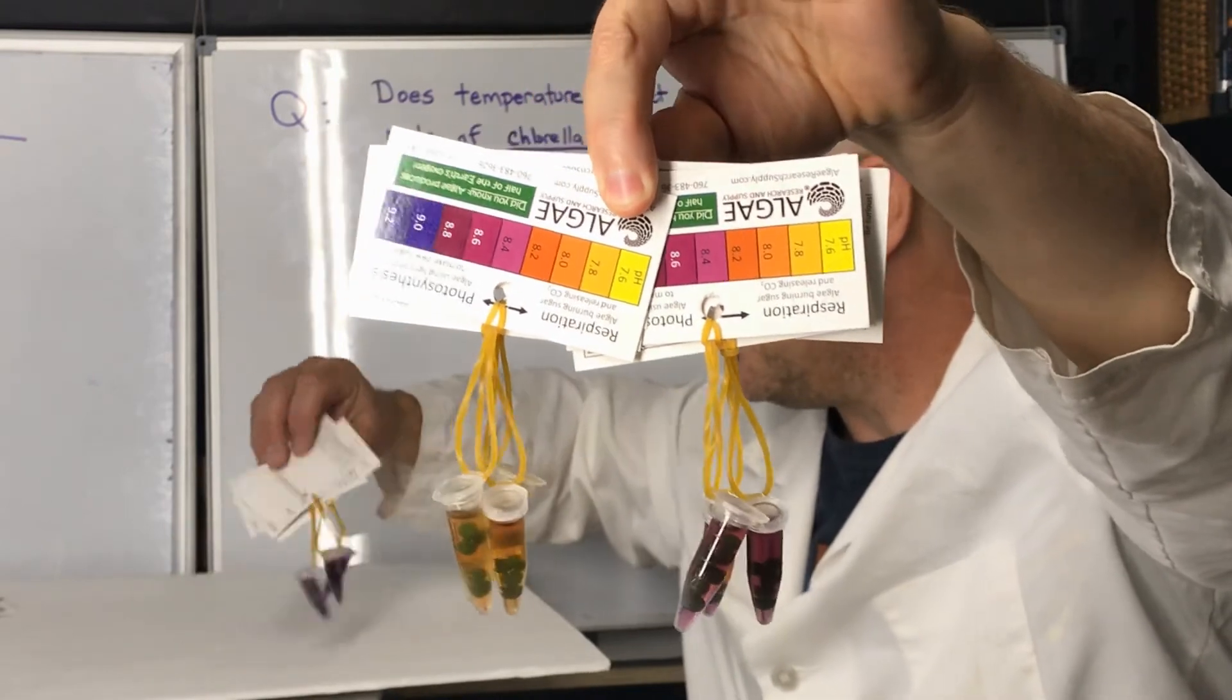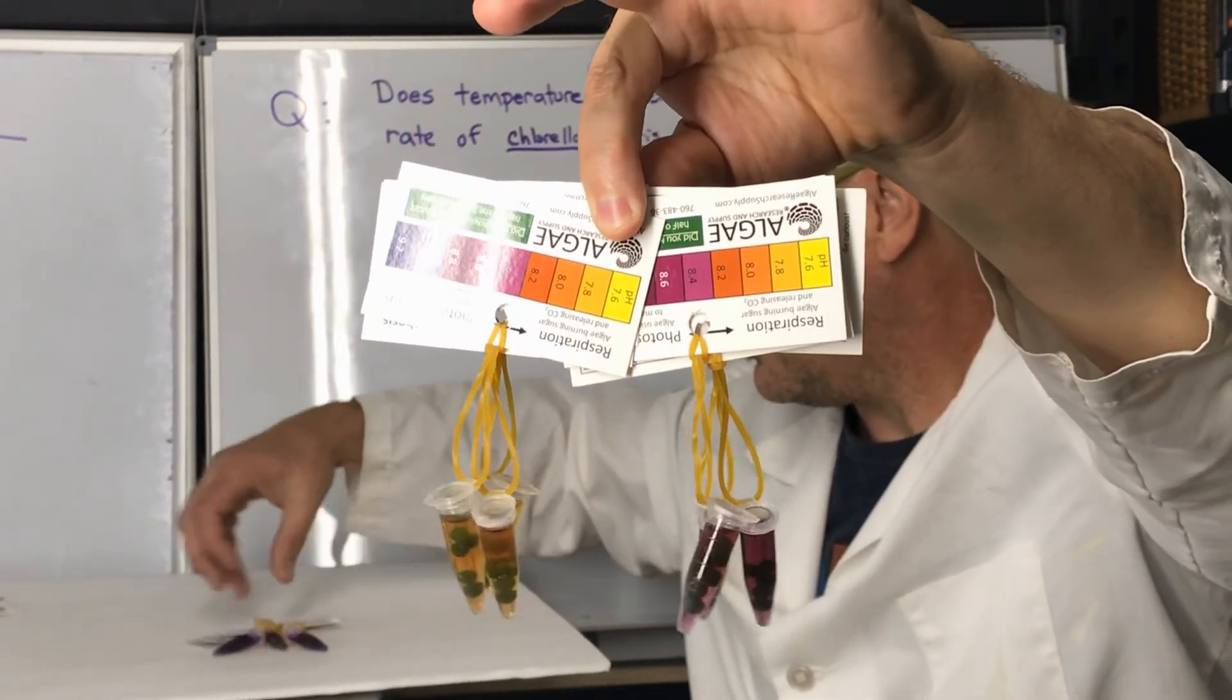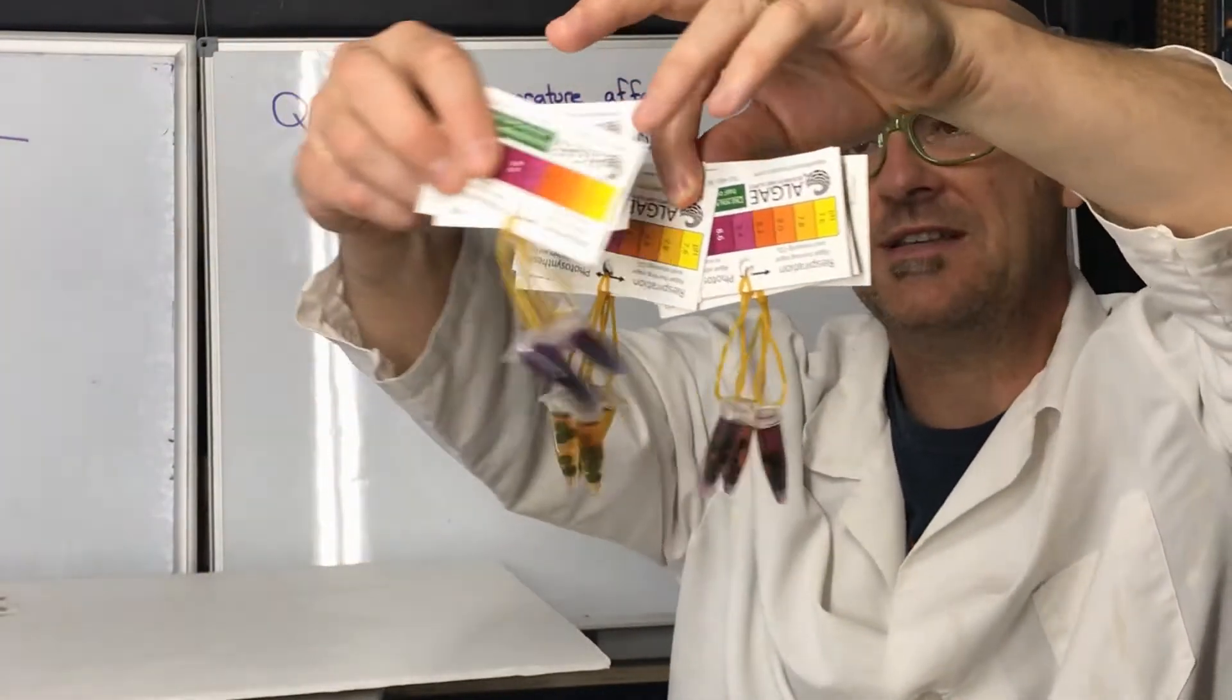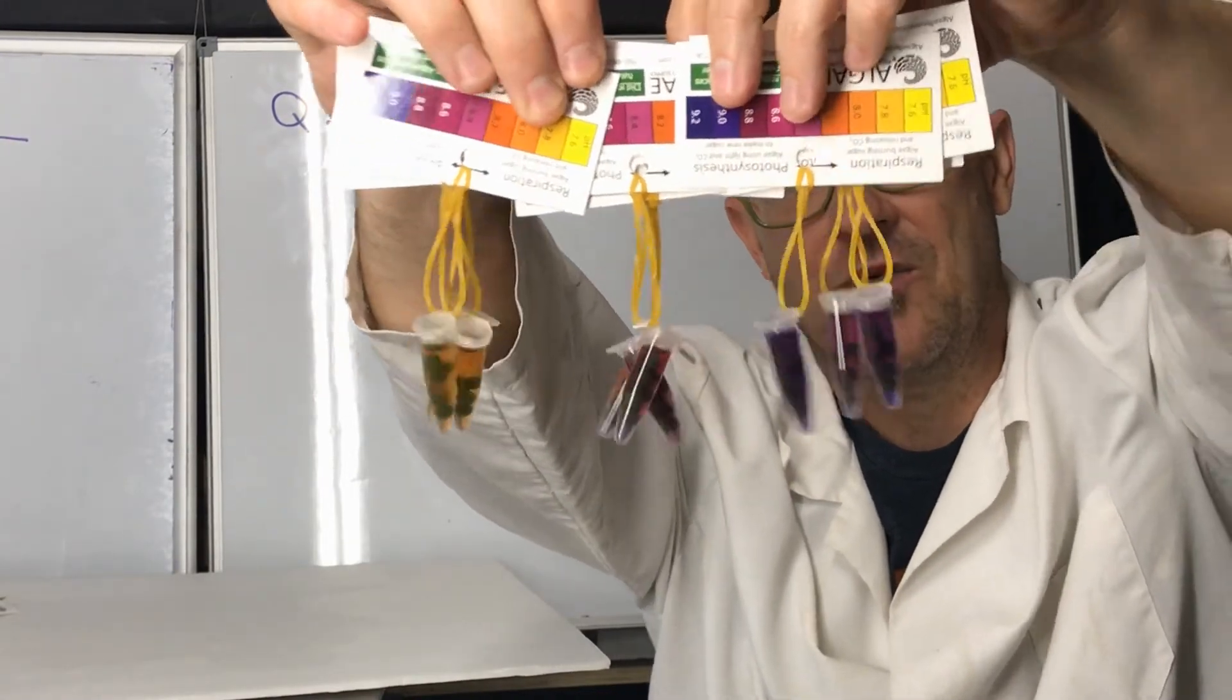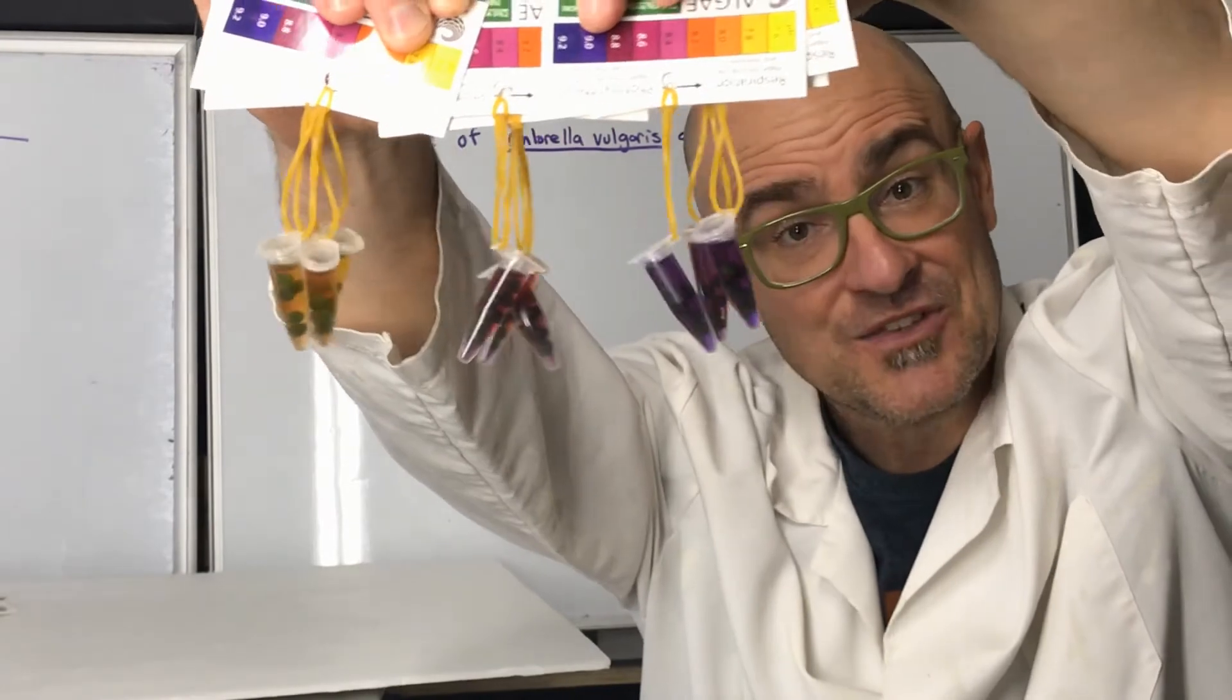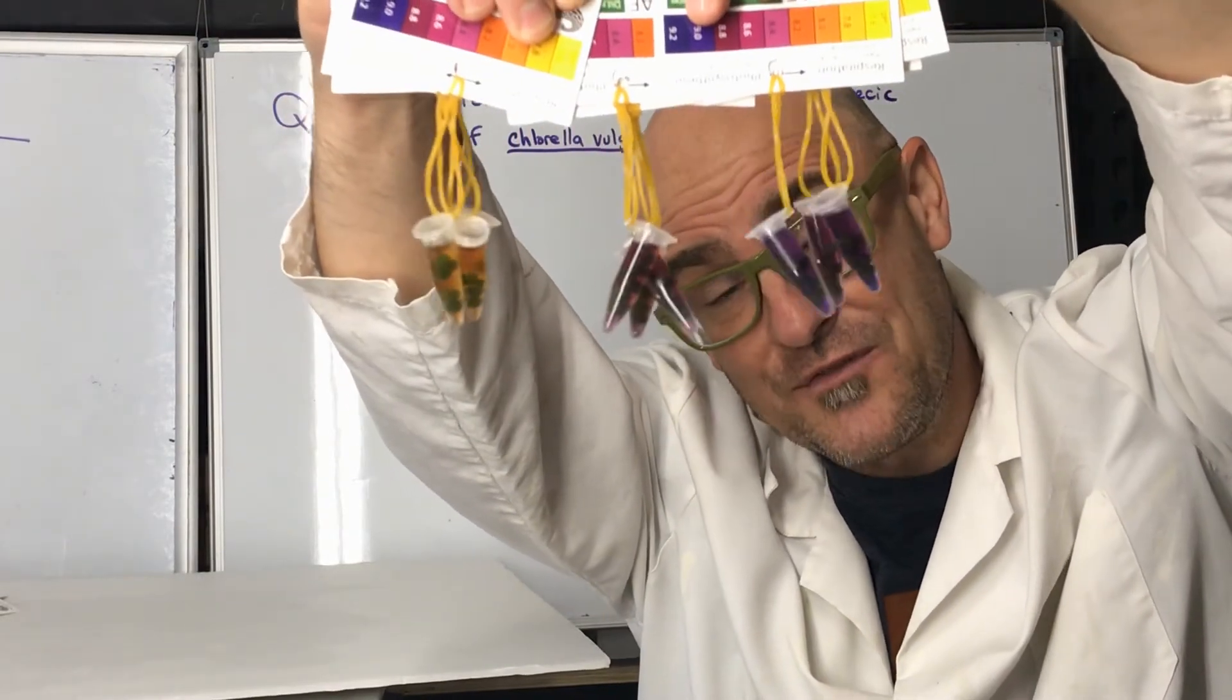And finally, in the warm water one, from the warmest tap water, these reached all the way up to maybe 9. So quite a bit of change went on with the photosynthetic rates there.